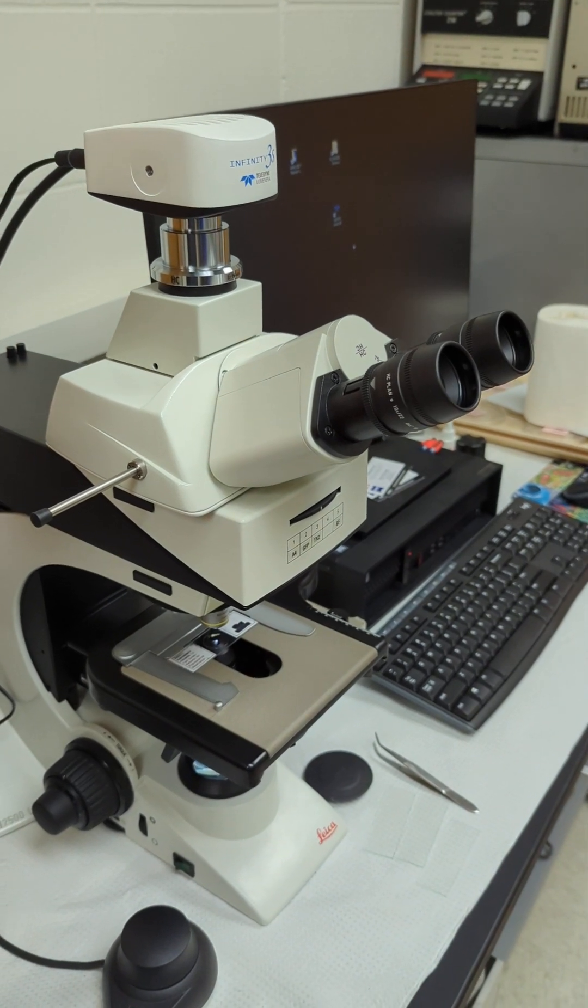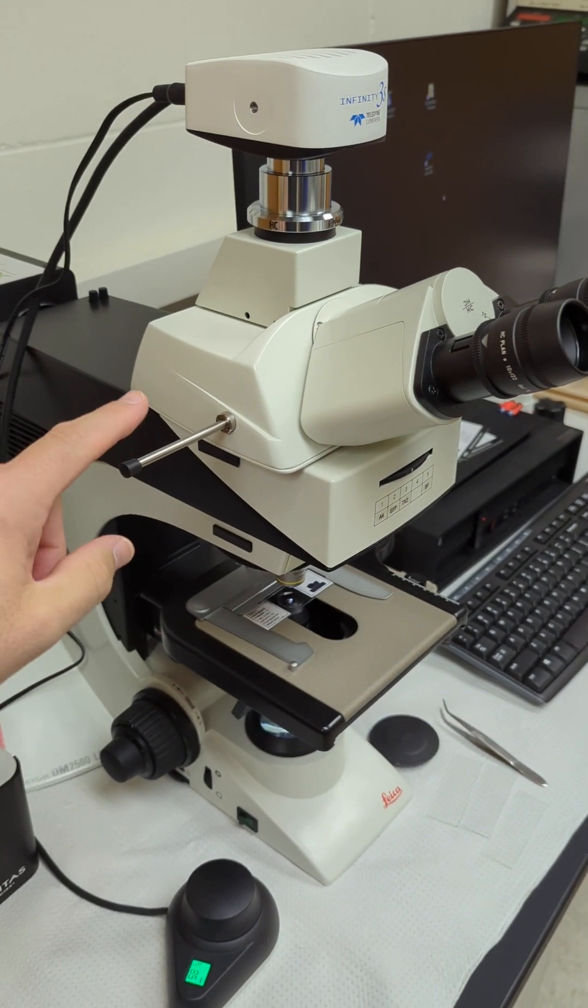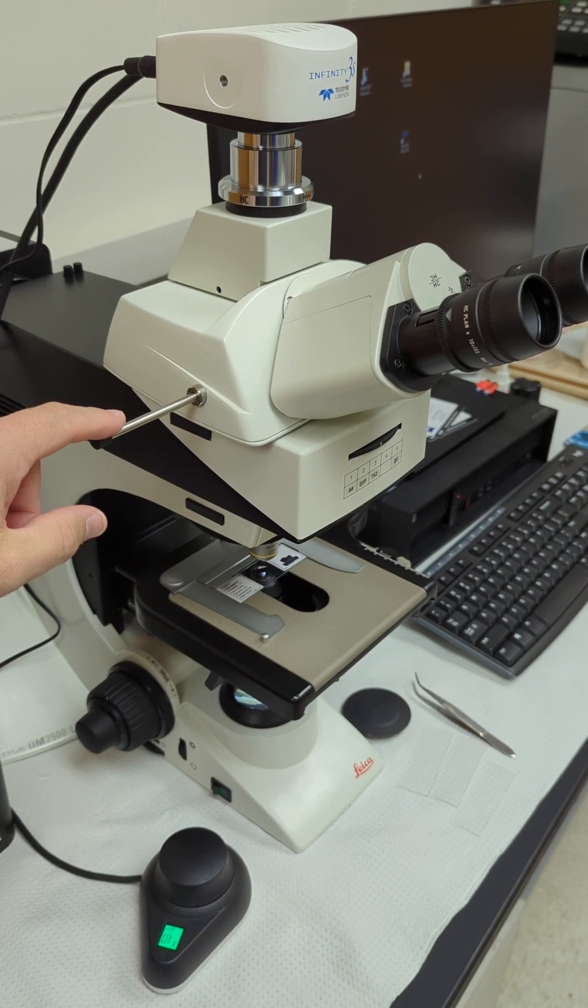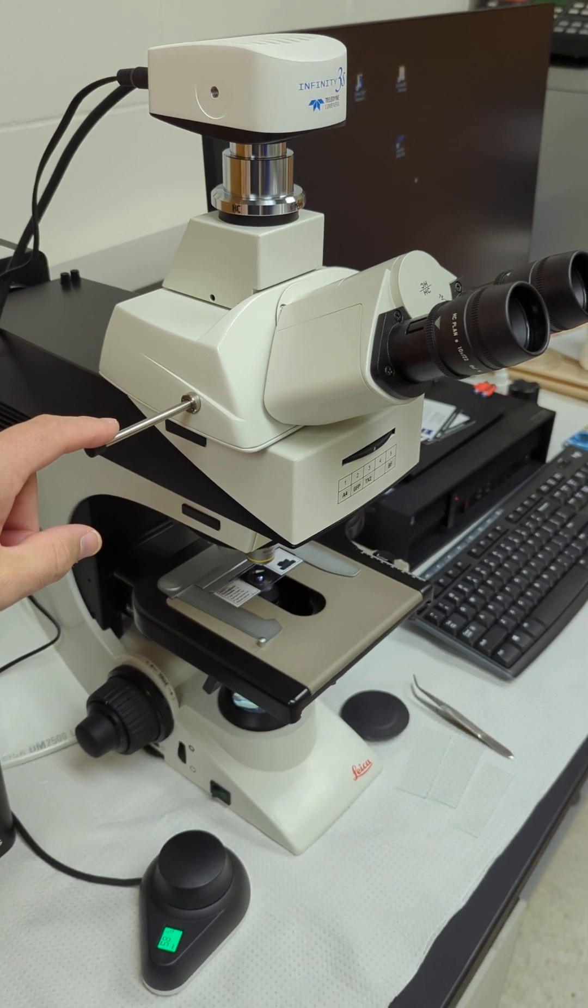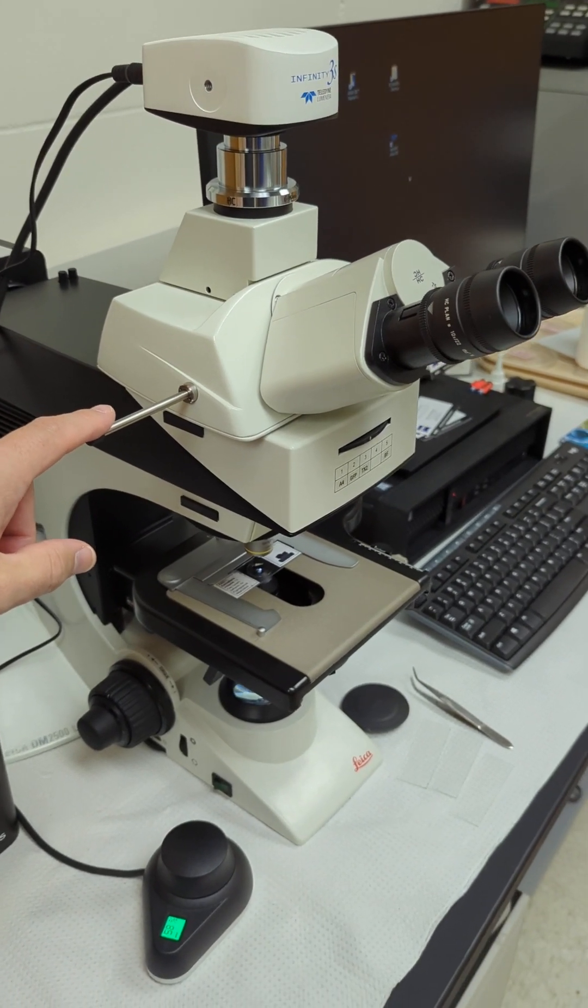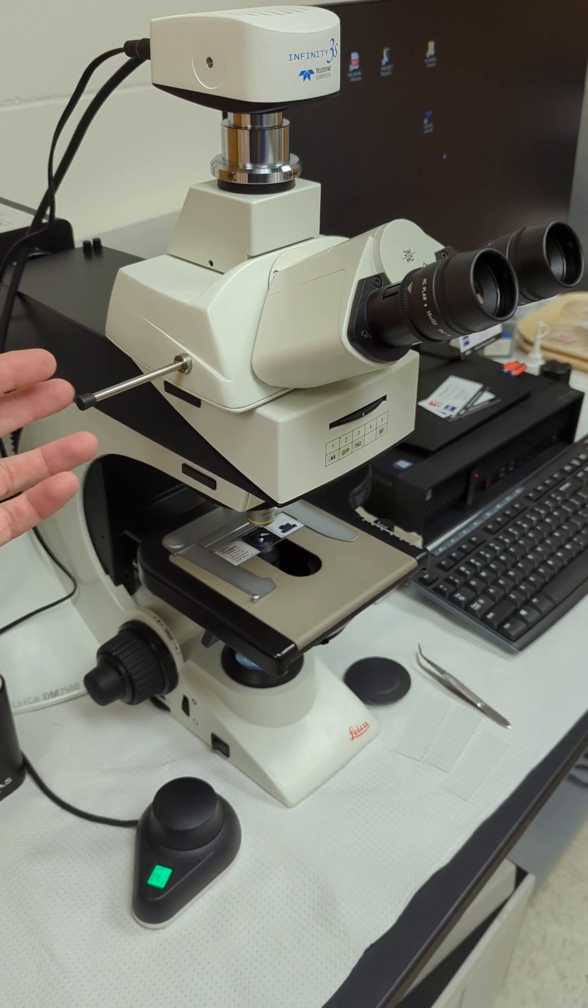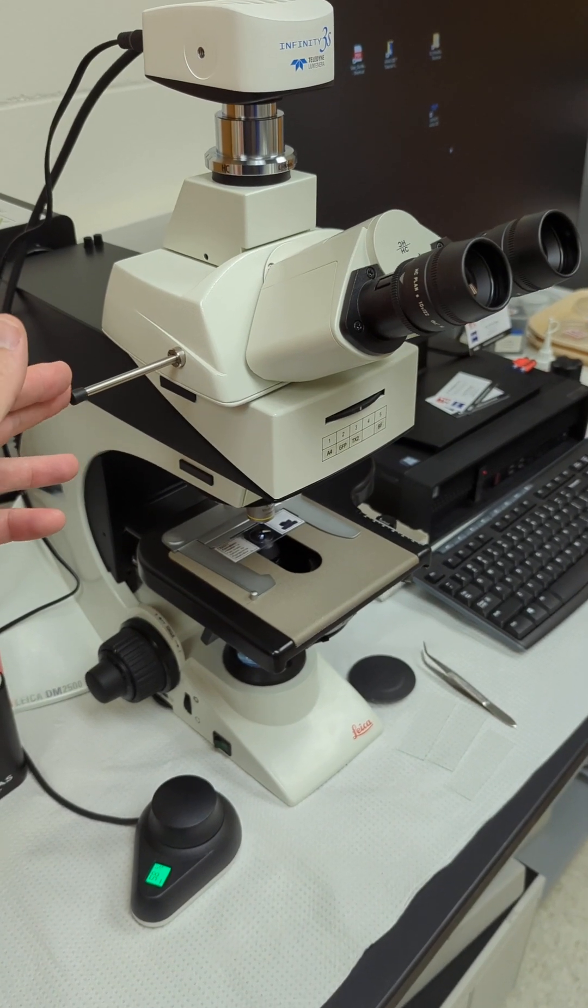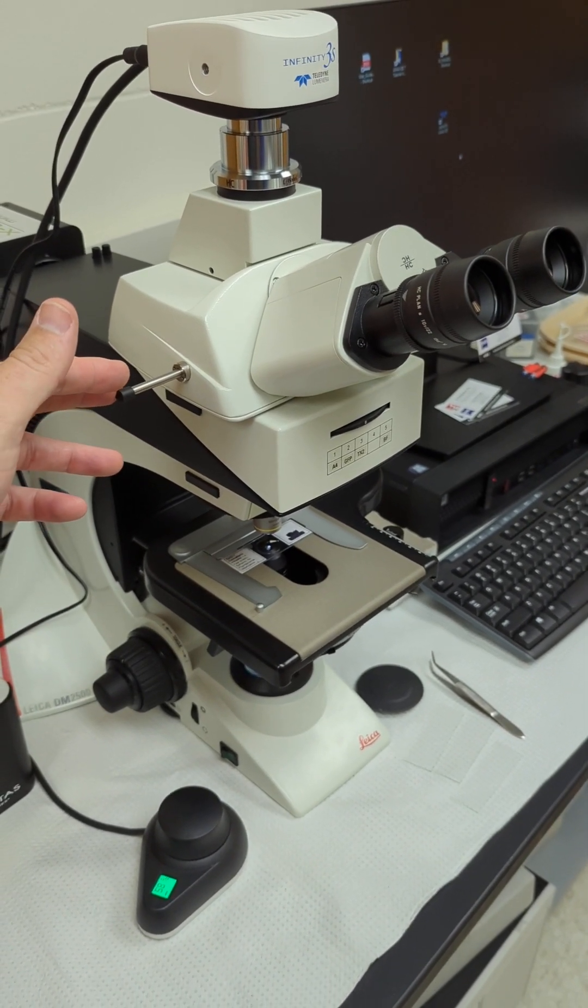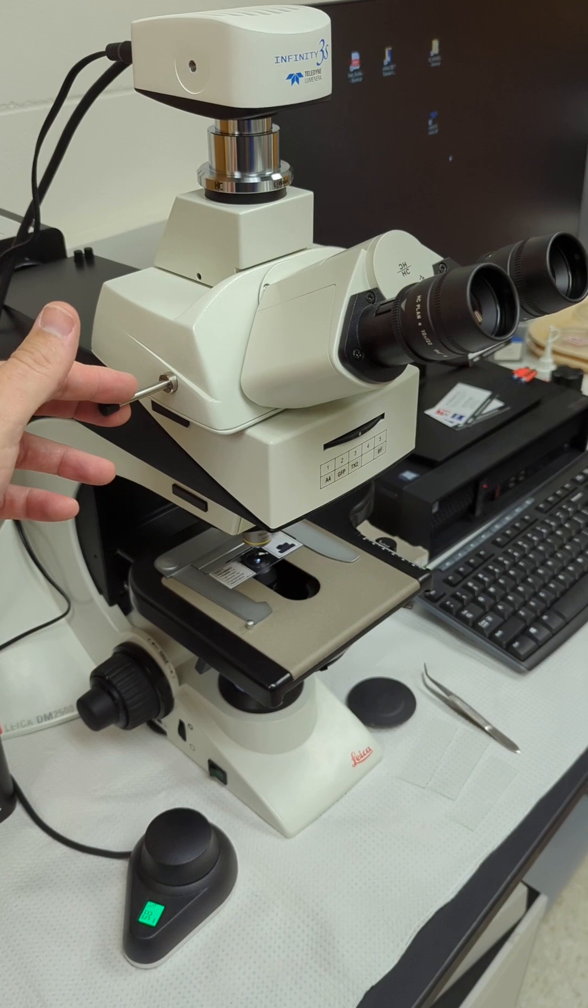So everything is only image on the monitor and all the light is going to the camera. In low light situations in fluorescence, you'd want it out like this. 50-50 is going to split that light, so you're losing 50% of it right there.